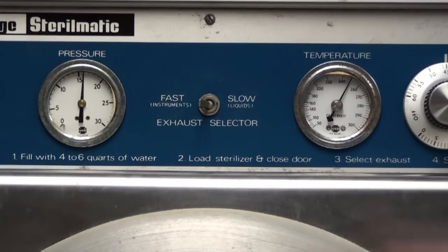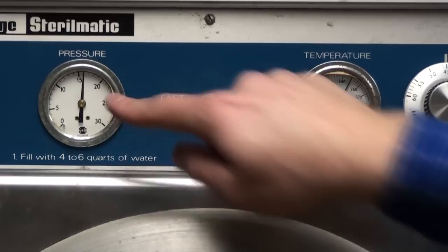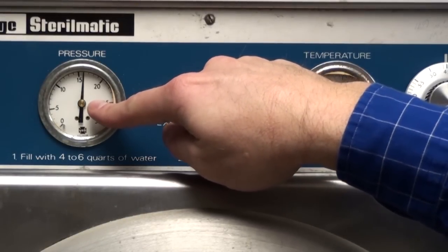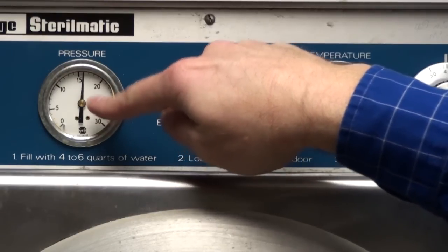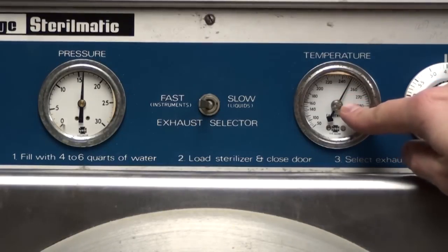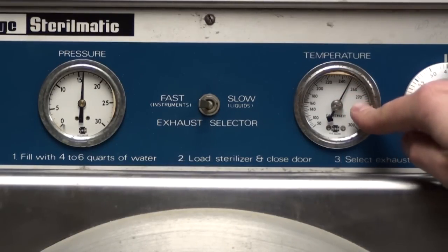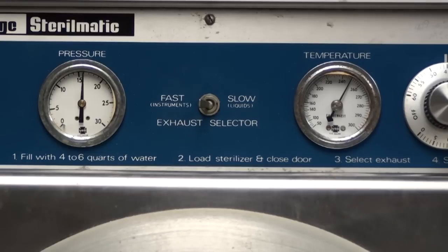As you can see, we're at pressure — above 15 pounds per square inch. No fooling about this: it is very dangerous to work with under extremely high pressure. It's at 250 degrees Fahrenheit, or approximately 121 degrees Celsius. This is now in the autoclaving, or sterilization, mode.